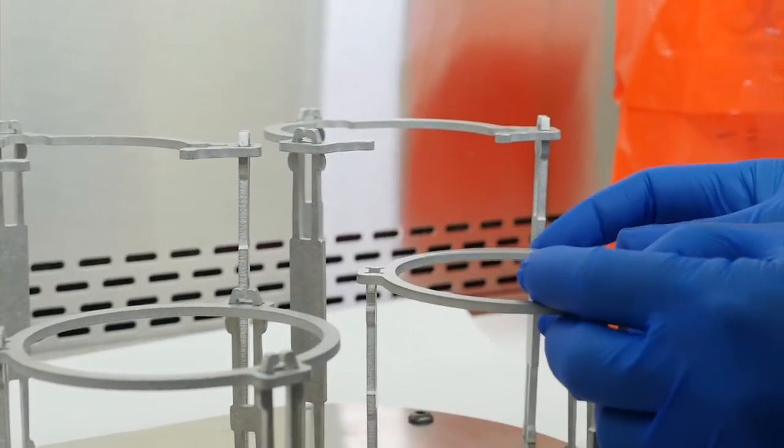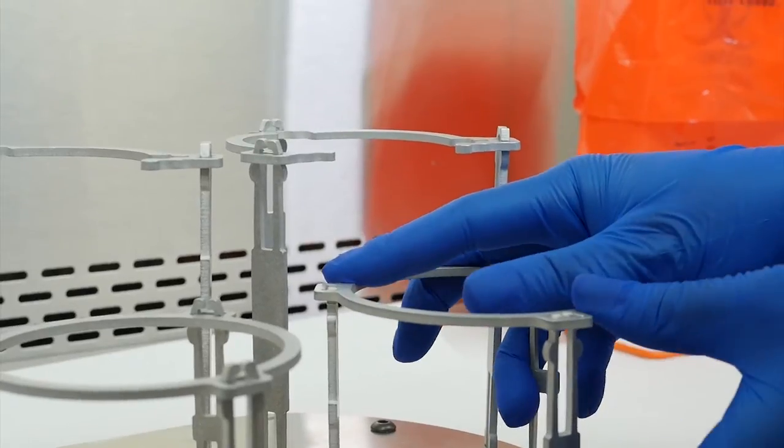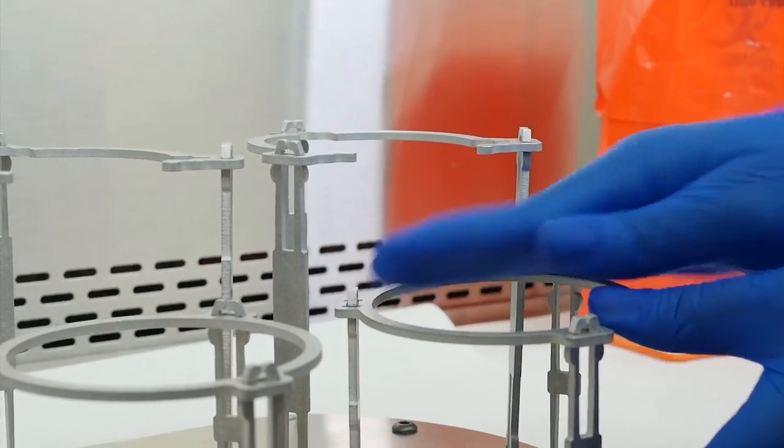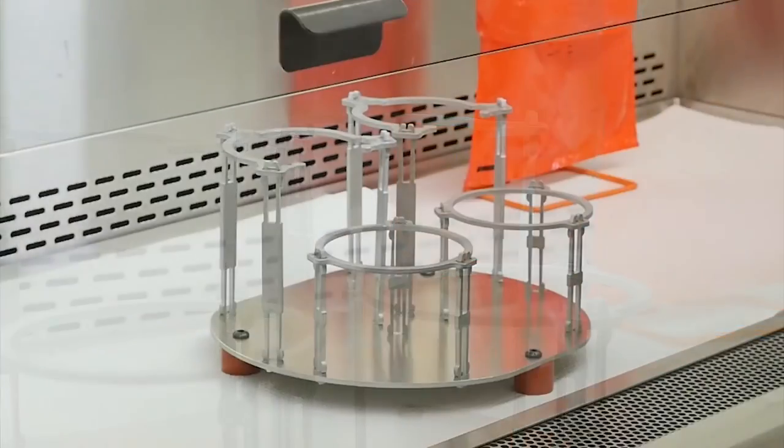Insert the circular connectors into the two sets of short front legs. Your elution device stand is now assembled.